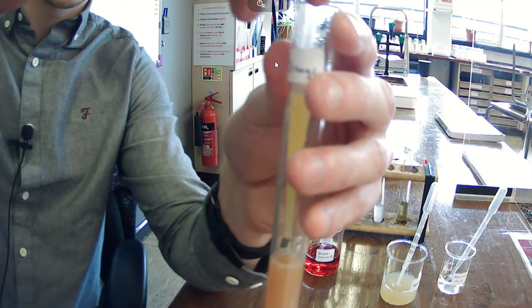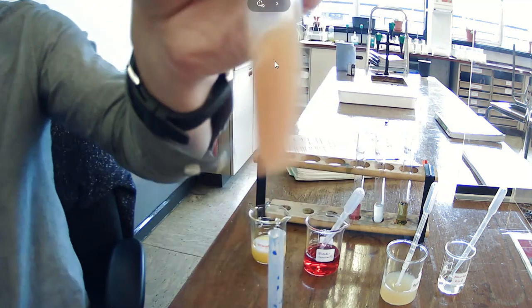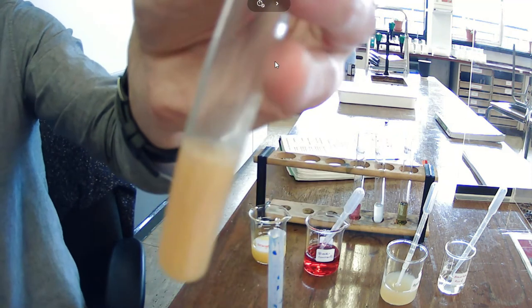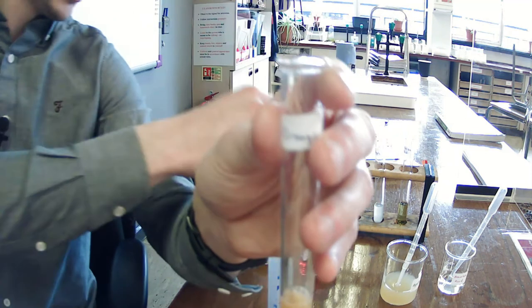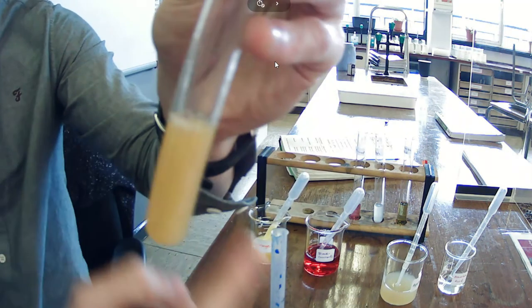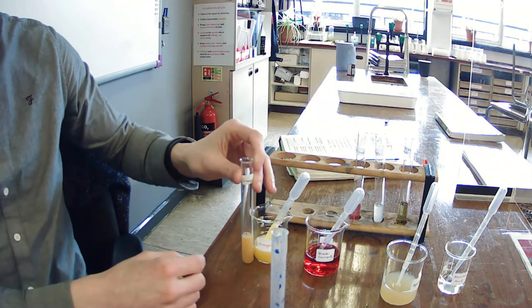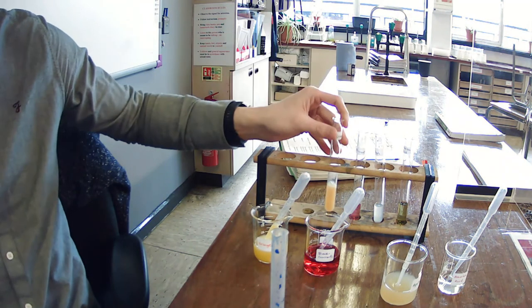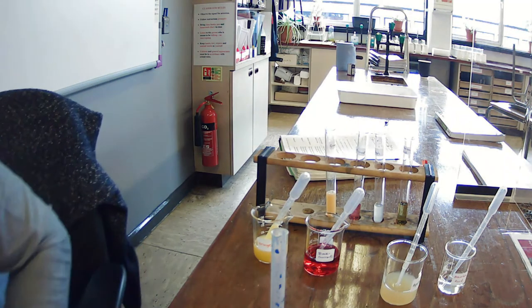68, and at 68, that took 68 drops. We now have an orange color solution, very similar to our orange juice. So that's our final result.